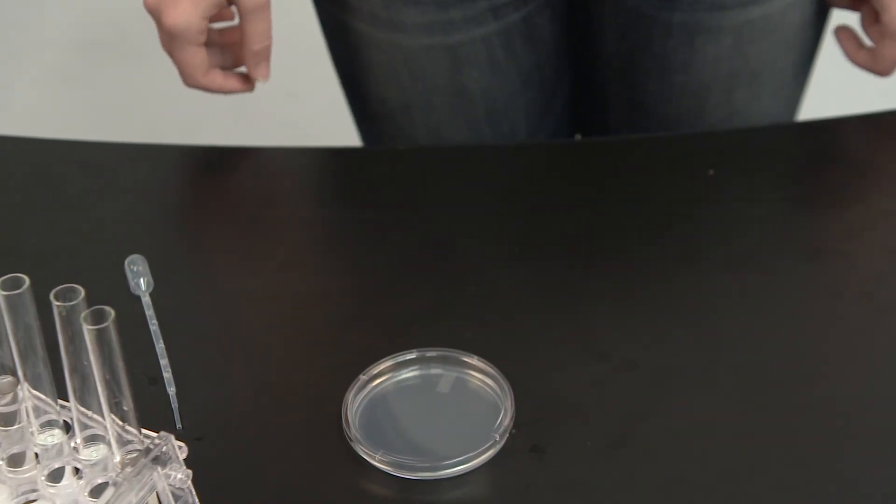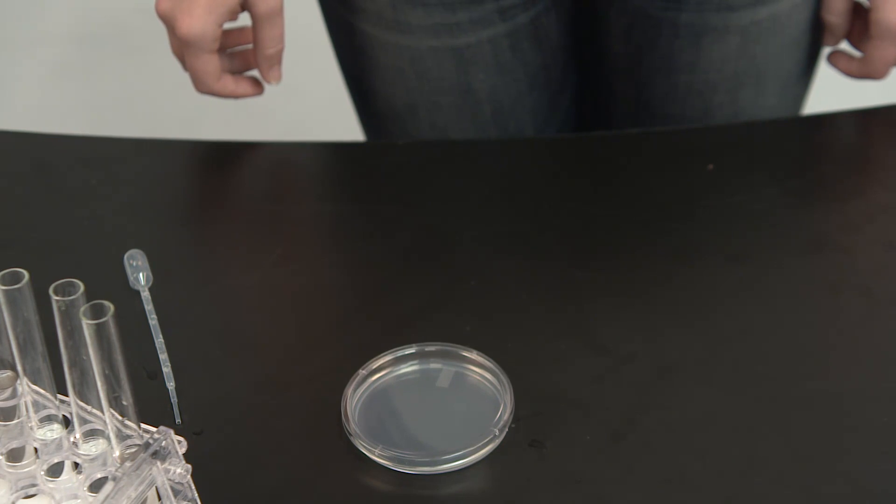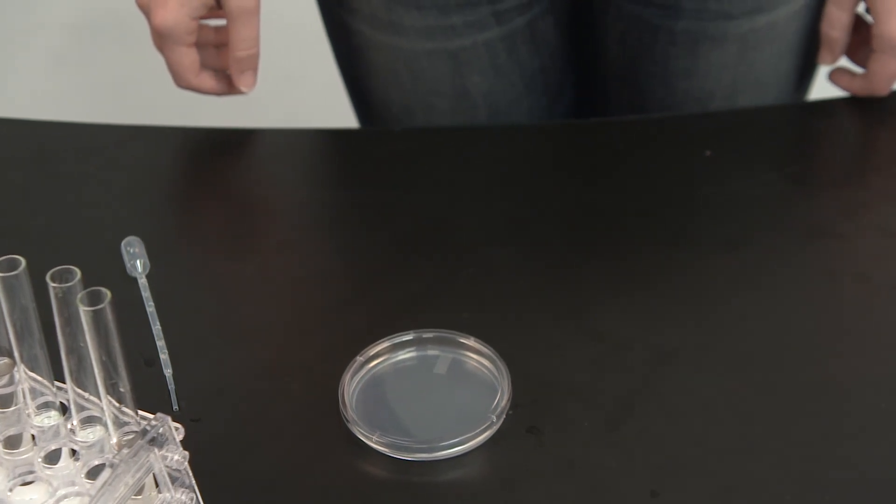This plate is sterile. Do not touch the agar or anything inside the plate unless the object that you're using is also sterile.